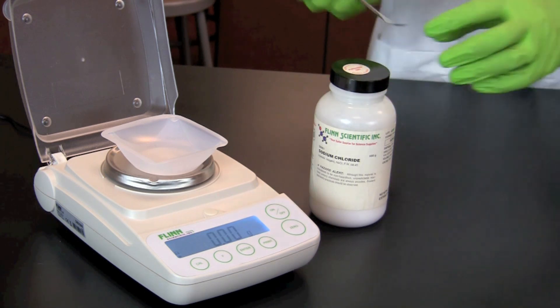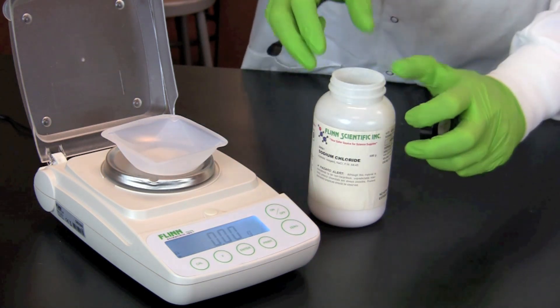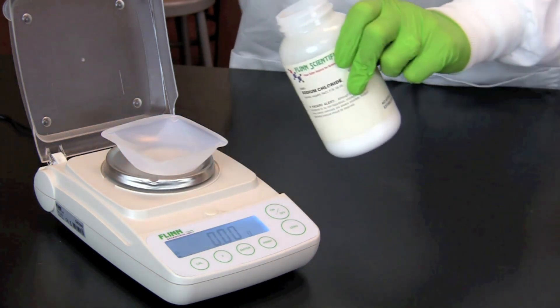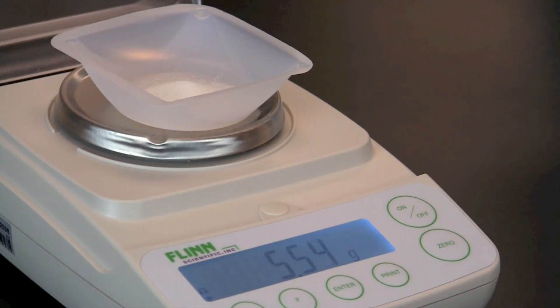Using an electronic balance with a weigh boat, we carefully measure out 5.84 grams of sodium chloride.